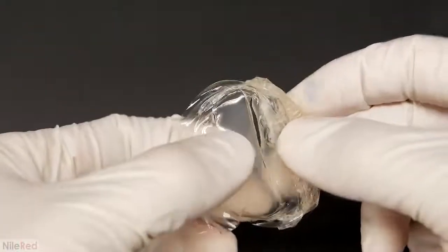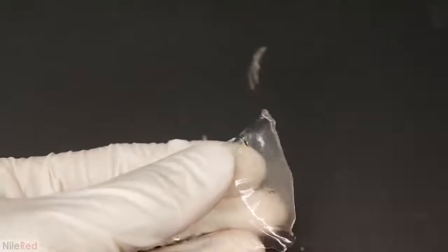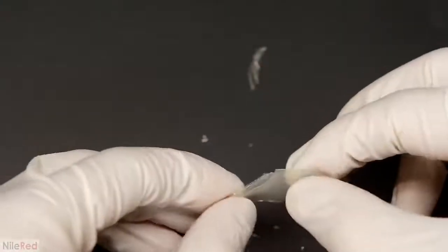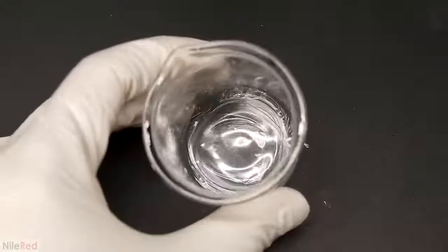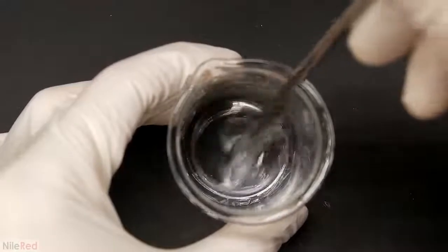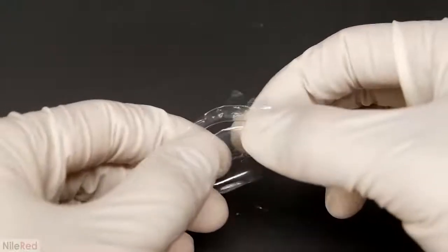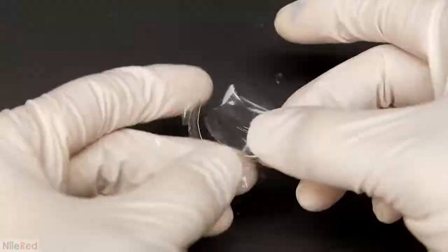I decided to take a closer look anyway, and as I expected, it was really brittle. There was little to no flexibility, and it snapped and shattered with only a bit of bending. What's kind of funny is the small remains that were left in the beaker actually gave better results. It was still brittle and useless, but clearly slow evaporation was important for getting a good film.